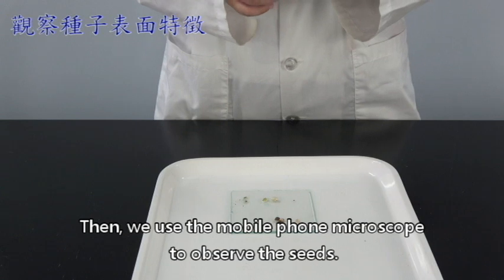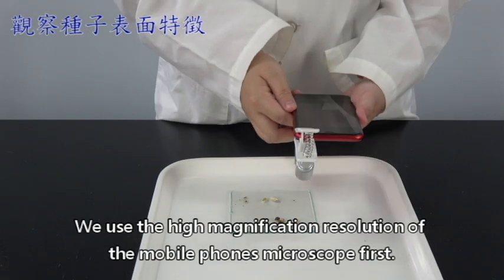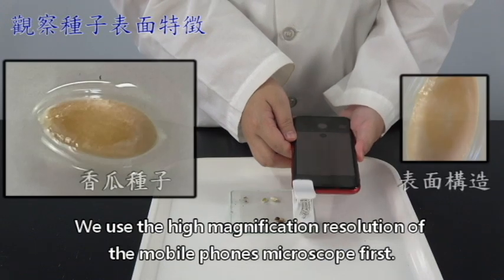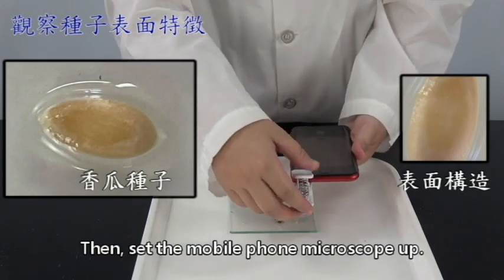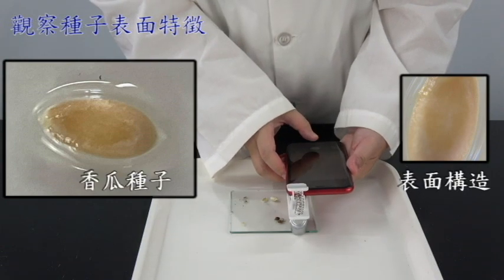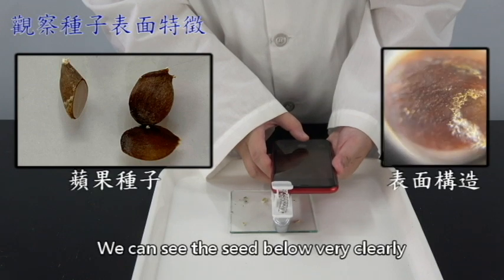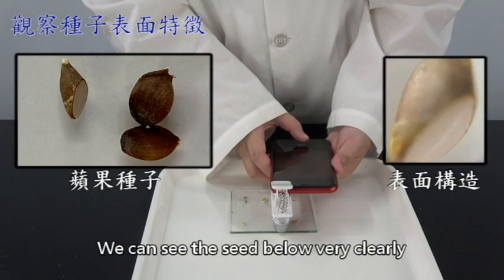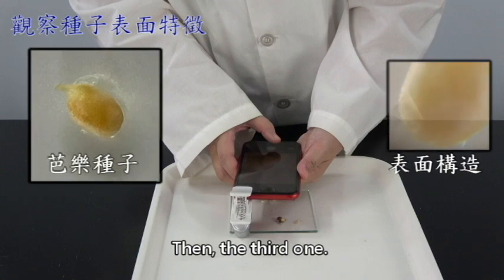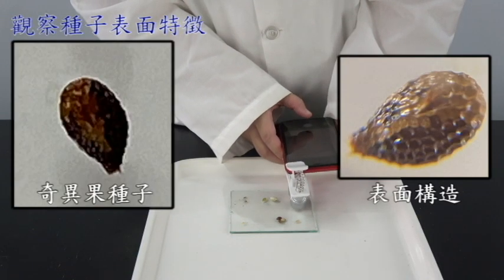Then we use the mobile phone microscope to observe the seeds. We use the high magnification resolution of the mobile phone microscope first. Then set the mobile phone microscope up. We will take pictures of the seeds one by one. We can see the seed below very clearly. Then the third one. Fourth one.